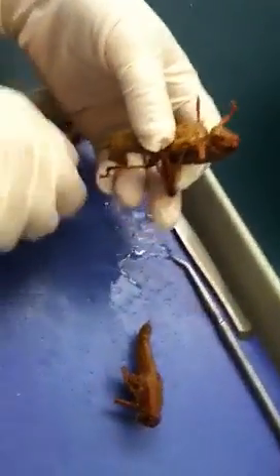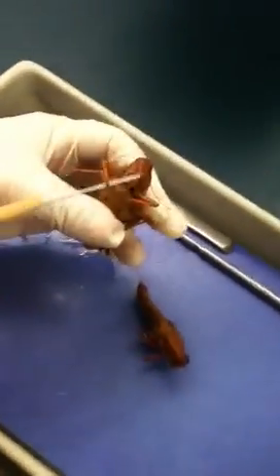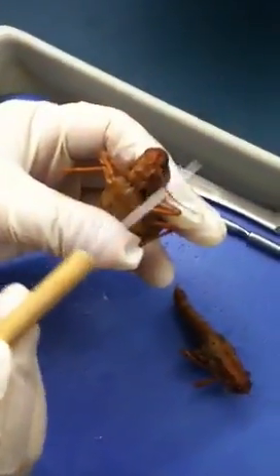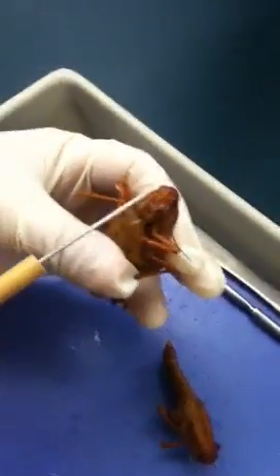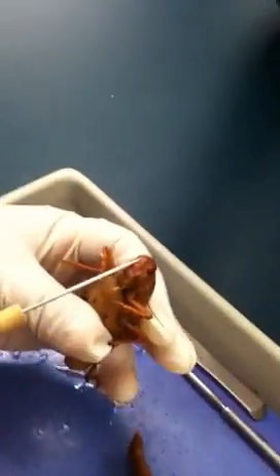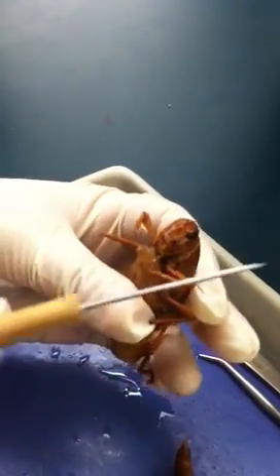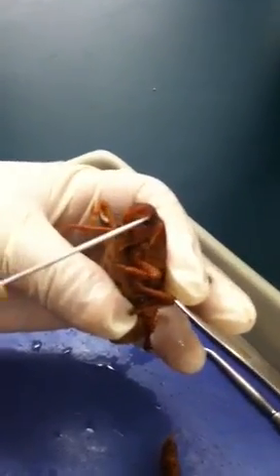After that, we need to get into the head parts. For their head, they have antennae — just like regular antennae, although unfortunately one just fell off on this one. And then the eyes are what we call compound eyes.